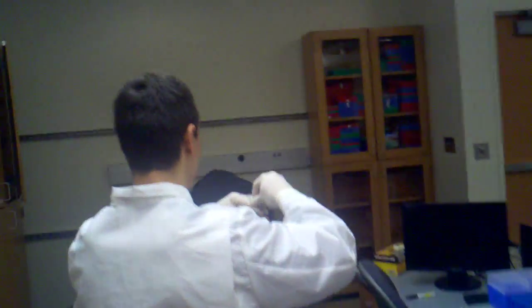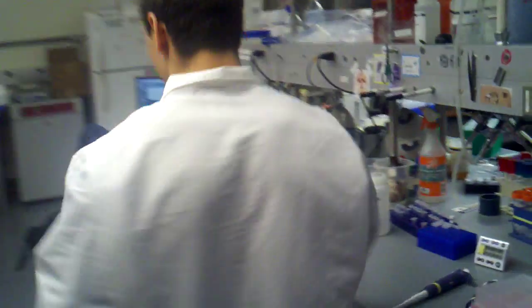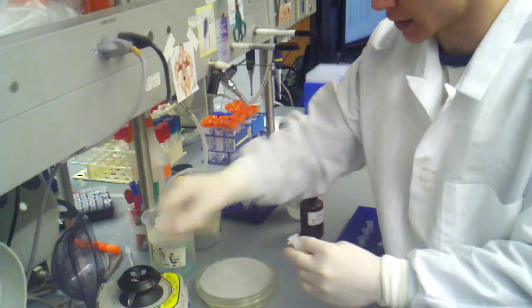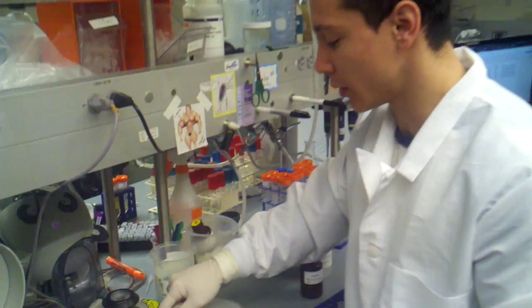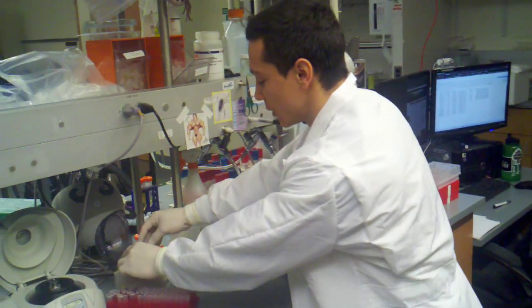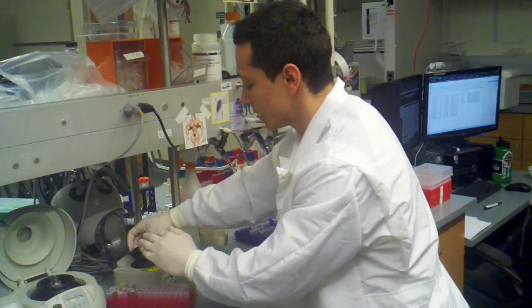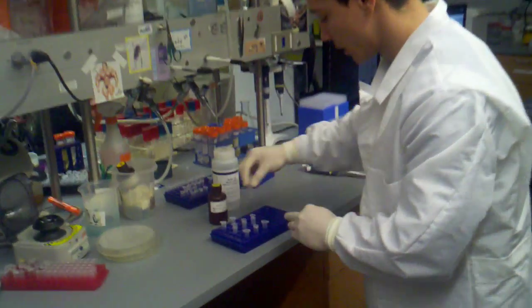I always want to be very careful when you're looking at these tubes to make sure that there's no chunks, because any chunks will clog your Zymo column. That's just no good. So I'm going to just give a quick little spin down that will dry them of that water that I put in there, and it'll just spin all the liquid down. Make sure I don't have any beads all over the place, beads of liquid, so that I have samples two, three, and four.